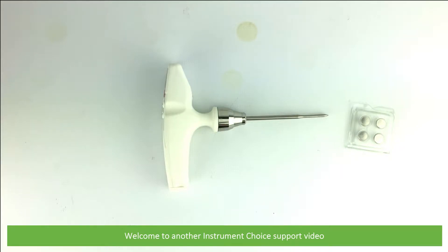Hi and welcome to another Instrument Choice support video. In this video we'll run through the operation, how to set alarm limits and the settings of the Testo 105-1 Robust Food Thermometer (IC-0563-1051).